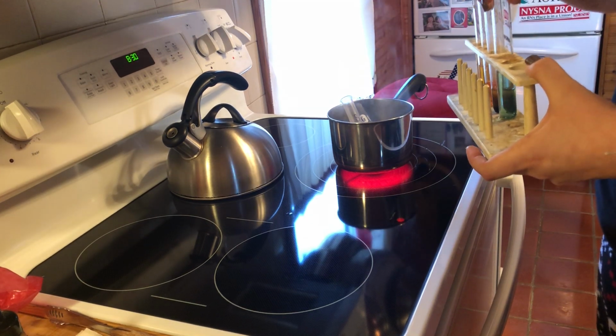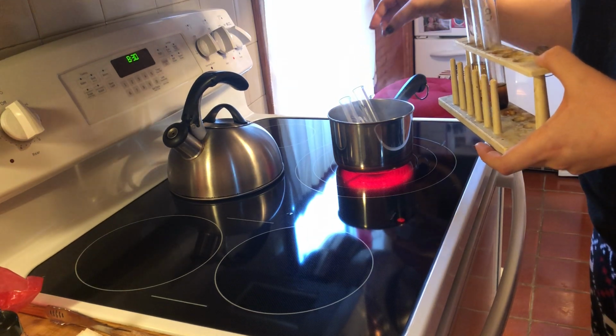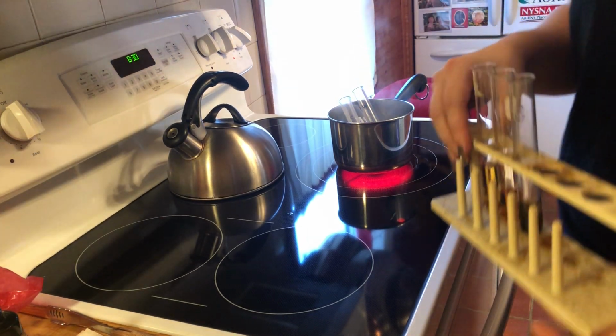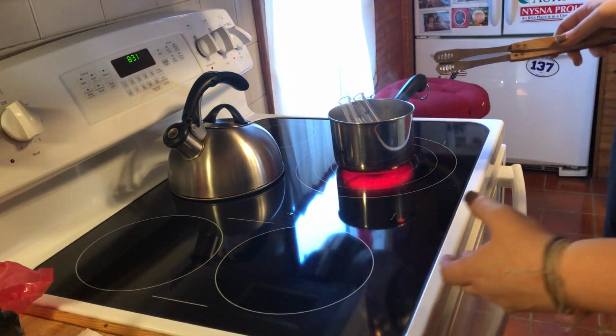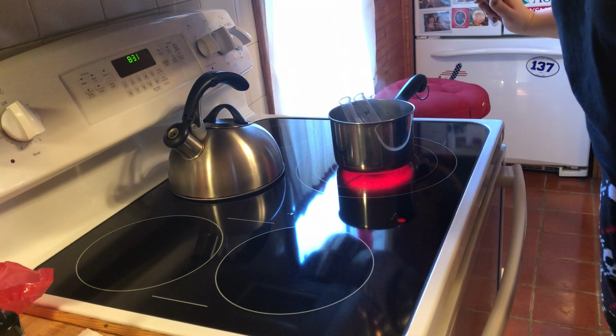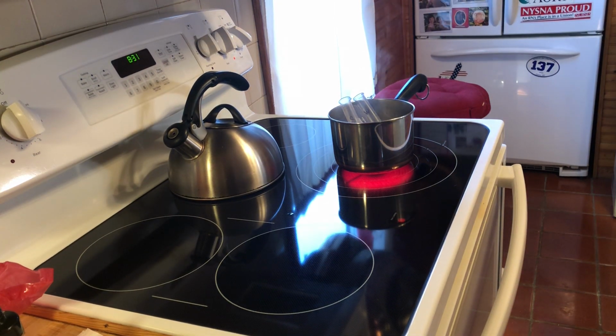Oh my gosh. So let's see if this works. I thought this pot would be high enough, but it's not. So let's let that sit in the hot water for a second. By the way, guys, you shouldn't be trying any of these things at home at all. That's why I'm doing them on video for you.